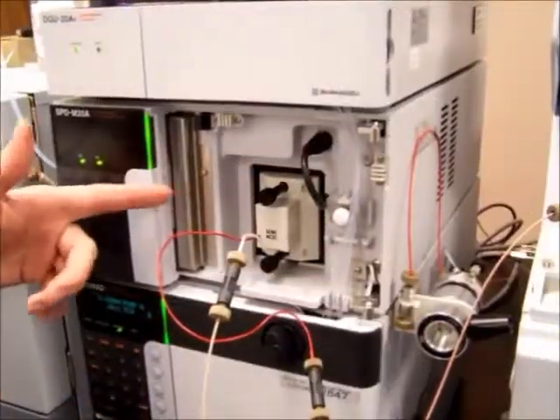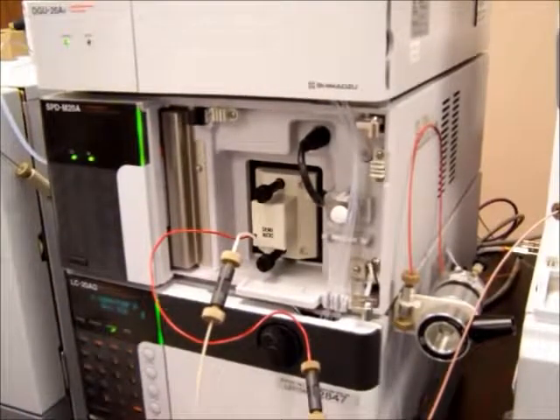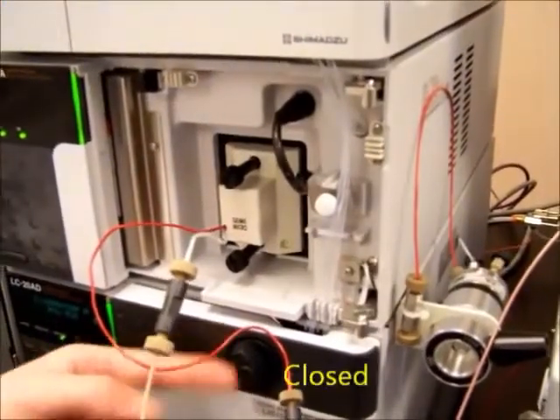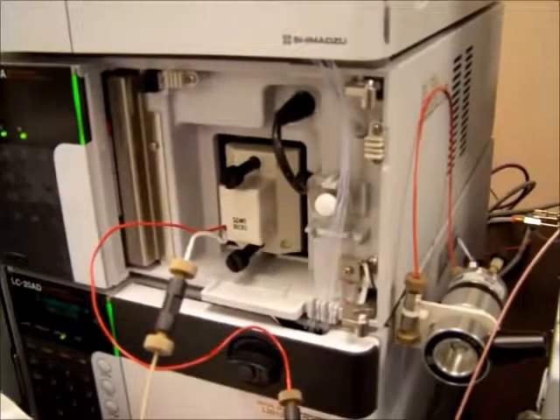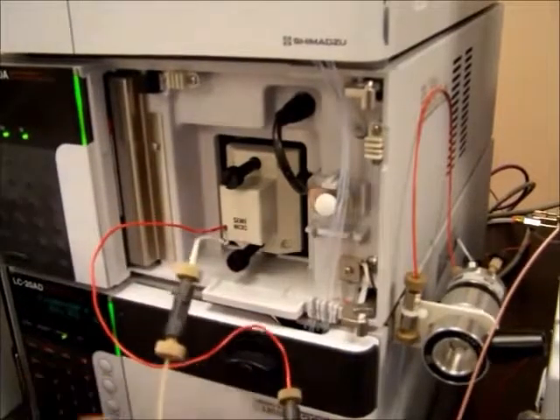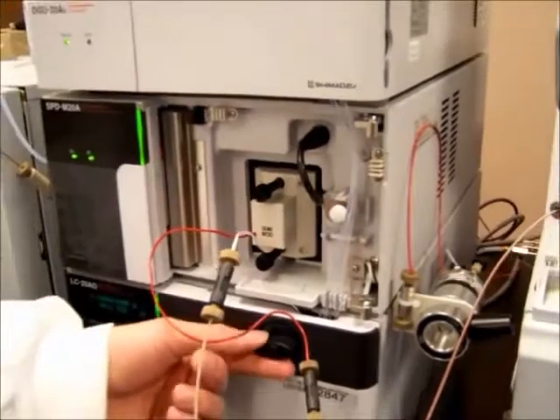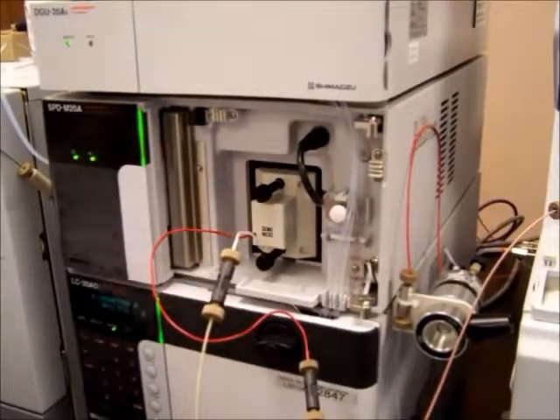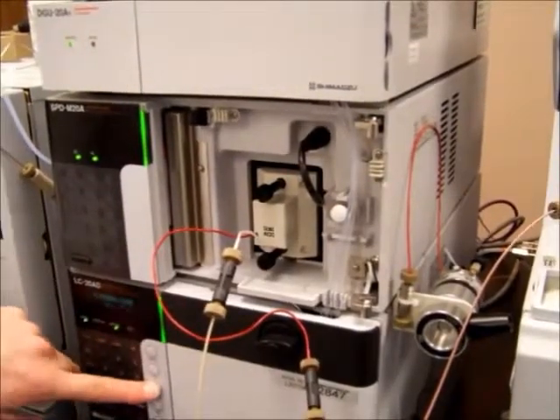Once the PDA has been turned on, the next thing we need to do is to purge the pumps. To purge the pumps, we need to turn the valves from their closed position to their open position by turning them 90 degrees counterclockwise. When these pumps are closed, any analyte traveling through the tubes will be going to the mass spec. When they're open, any analyte or solvent traveling through the tubes will go to waste. Once they've been turned, press the purge button, which is the center button.